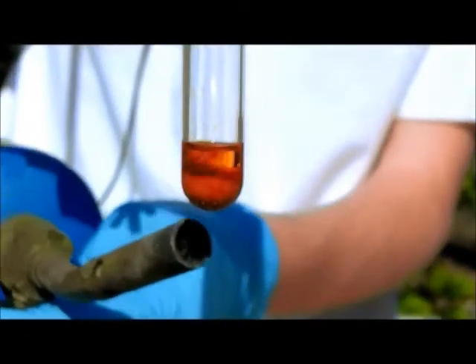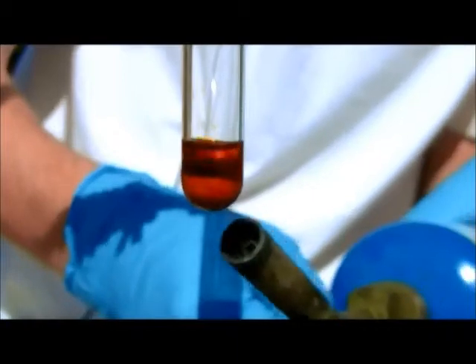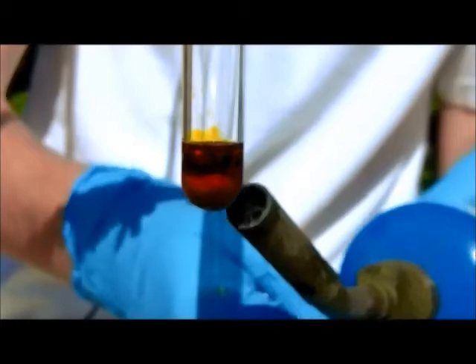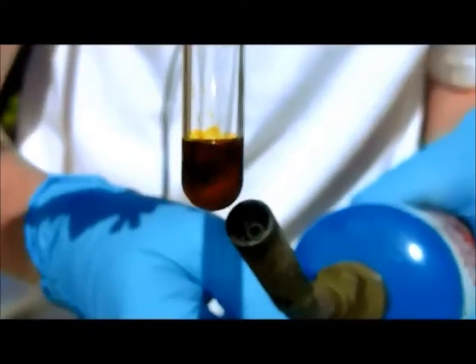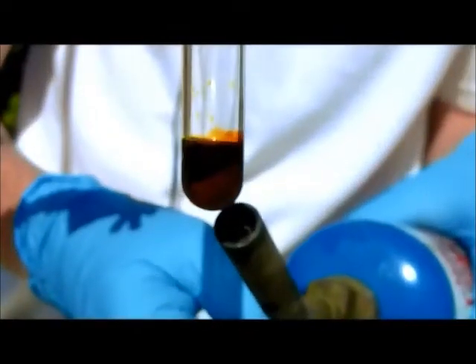So, you probably know that when dichromate is in basic conditions it forms the chromate ion, and vice versa. When the chromate ion is in acidic conditions it forms a dichromate ion. But what you probably don't know is that under extremely acidic conditions, such as this nitric acid, dichromate will actually form trichromate.